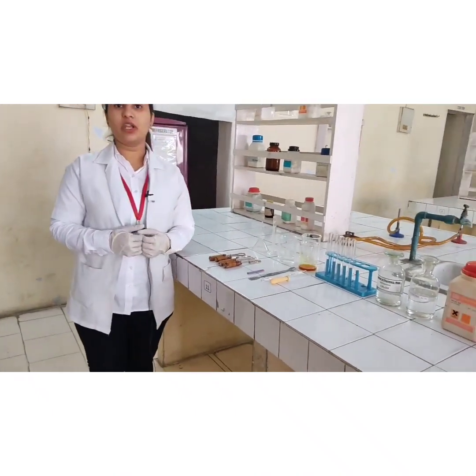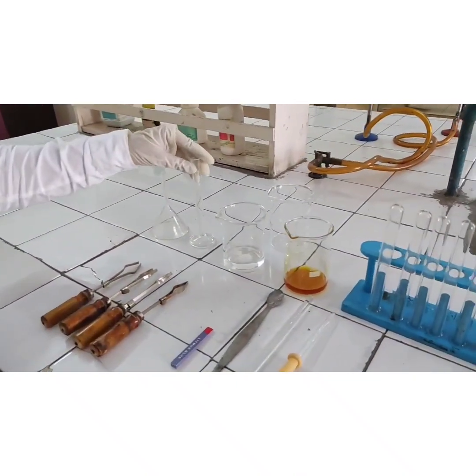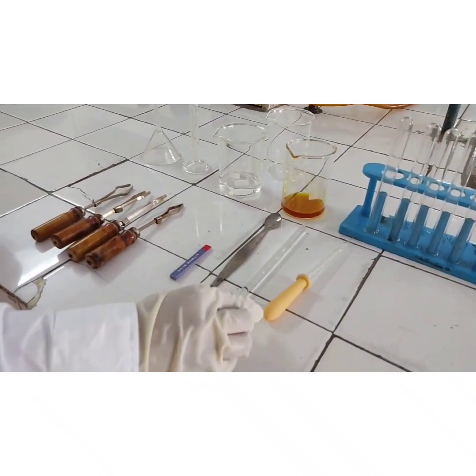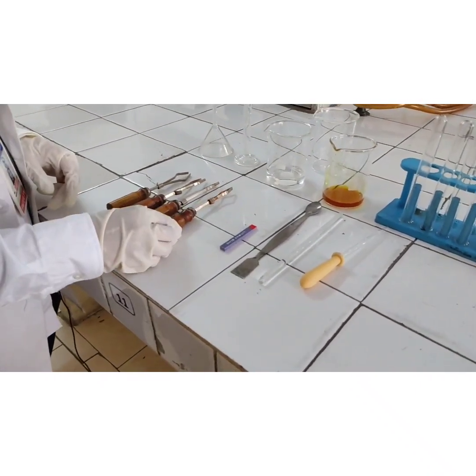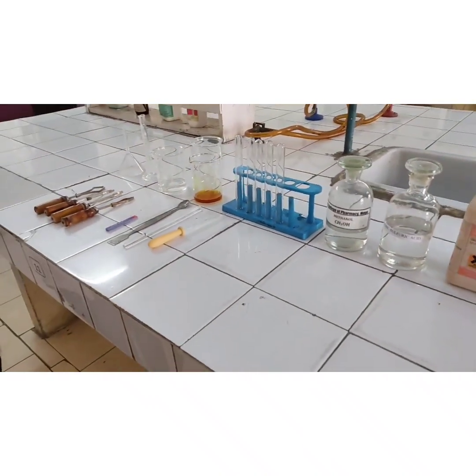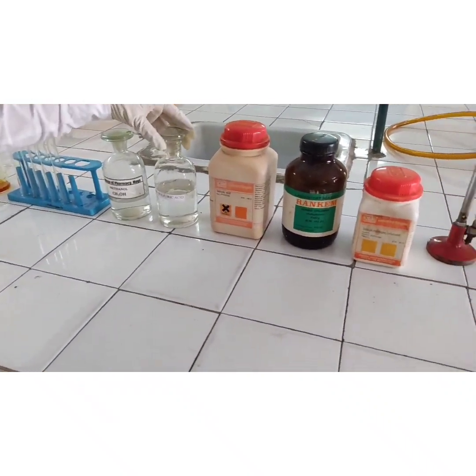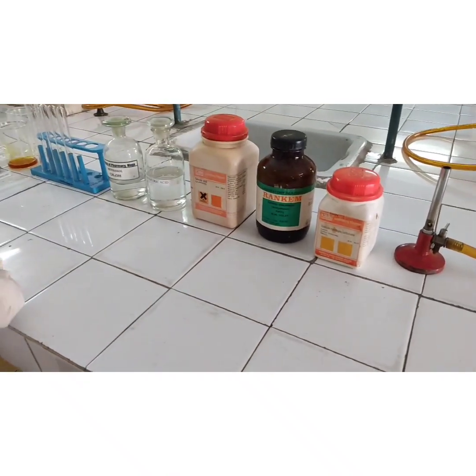Make sure while performing the experiment you should be wearing a lab coat and gloves. The glassware required for this experiment are funnel, measuring cylinder, beakers, dropper, glass rod, nickel spatula, test tube holder, test tube, and test tube stand. The reagents required are methanol, sulfuric acid, salicylic acid, ferric chloride solution, and sodium bicarbonate.